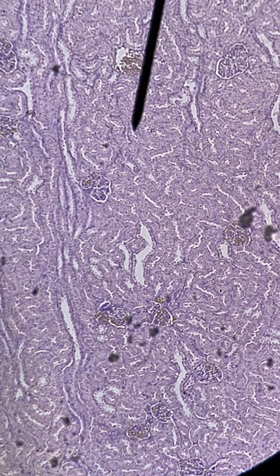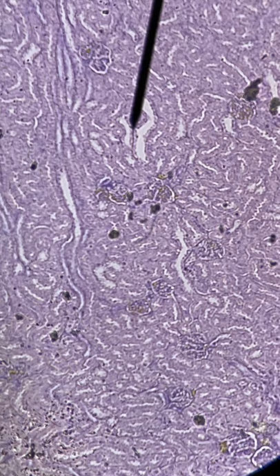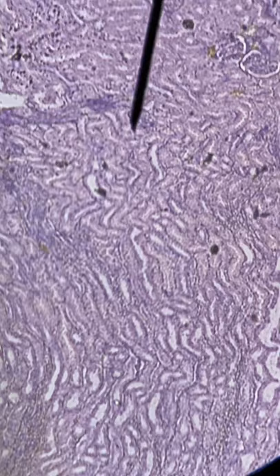You see all of these little corpuscles scattered all over the place. And when you get down here, you stop seeing them.